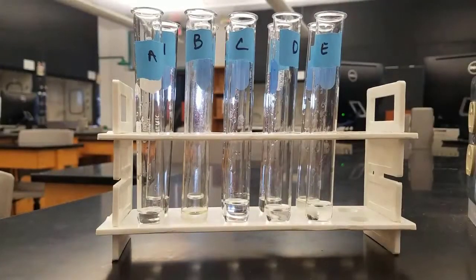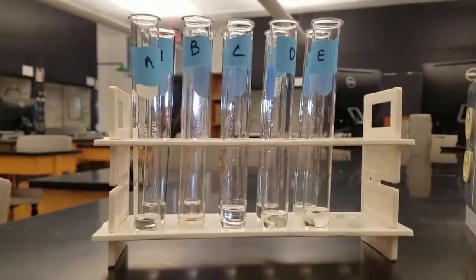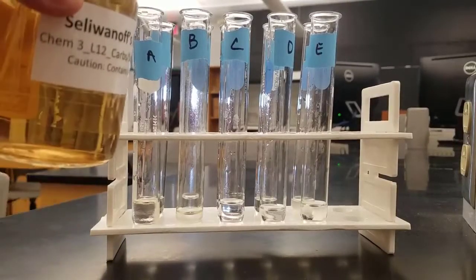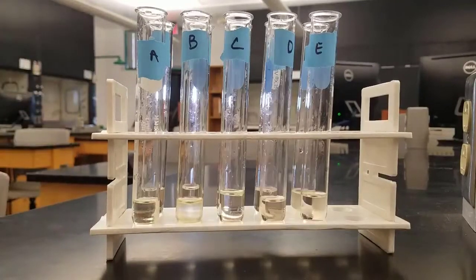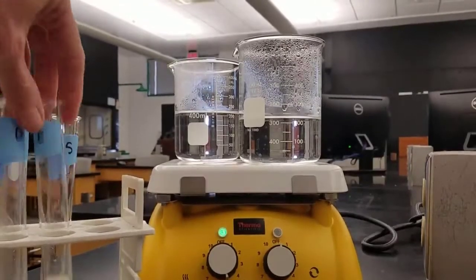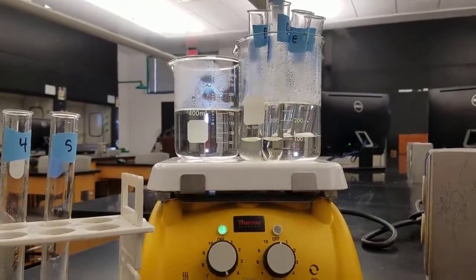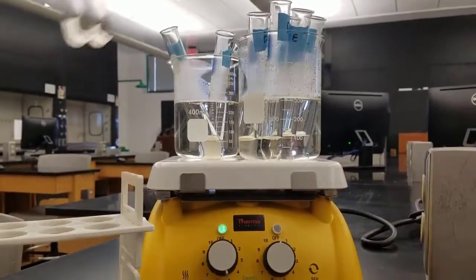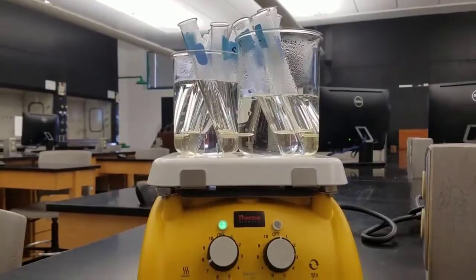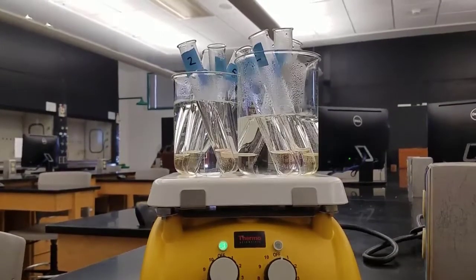A through E are the five unknowns you'll be figuring out today. We're looking for a comparison between those five unknowns and the known sugars. We add Seliwanoff's reagent — it has a strong acid in it, so be careful — one milliliter to each test tube. Then we place them in a hot water bath, because heat speeds up reactions. Watch for a dark orange or red color, which is a positive test for ketoses.